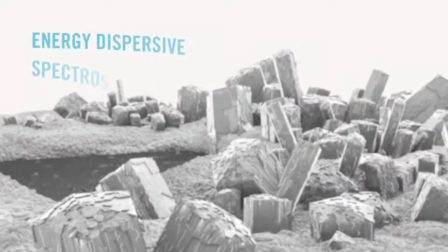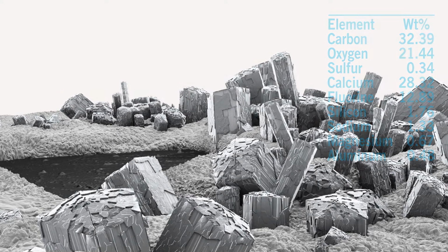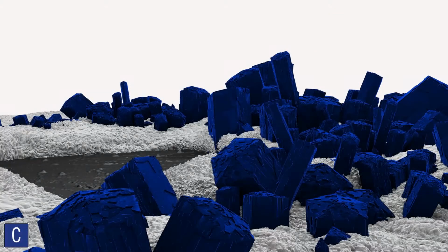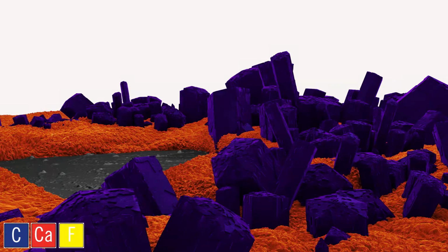We pair this technique with energy dispersive spectroscopy, or EDS. EDS tells us the relative concentrations of the different elements throughout the foulant. Although we now know what elements are present, we cannot see how these elements interact to form compounds or how they are layered in the foulant. But what if we could see where the carbon is present, where the calcium is located, where the fluorine resides, and finally, the distribution of the silica in the foulant?